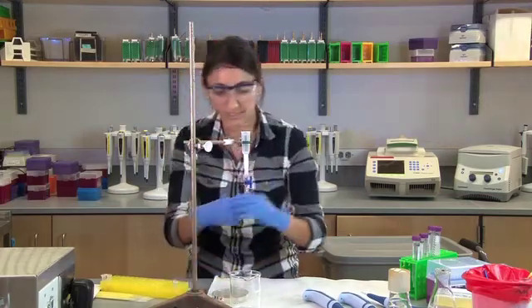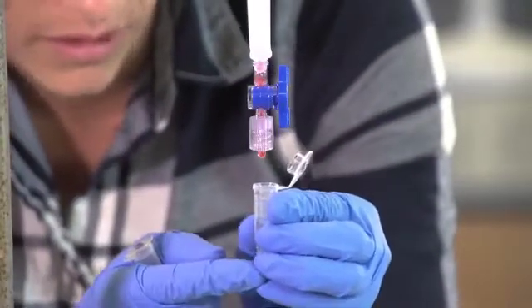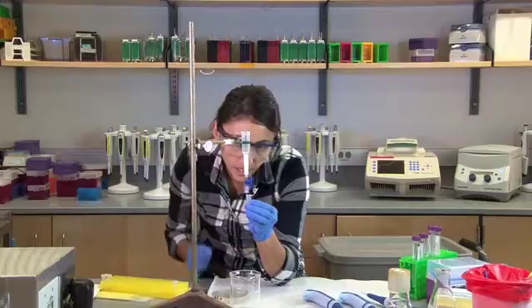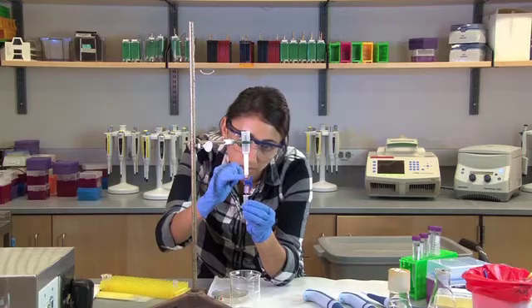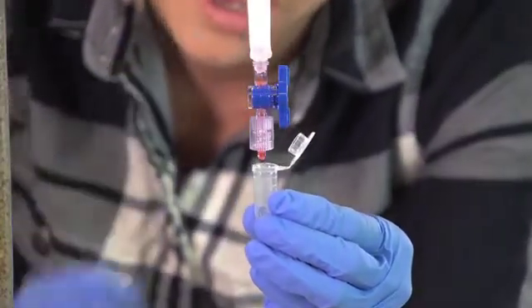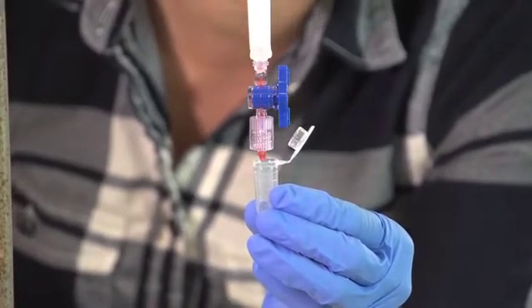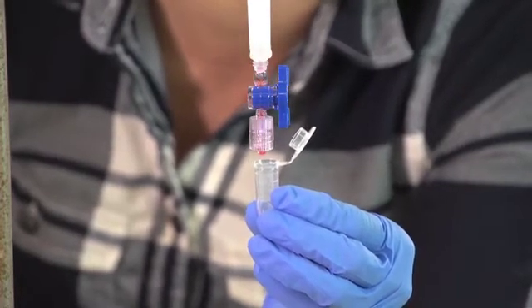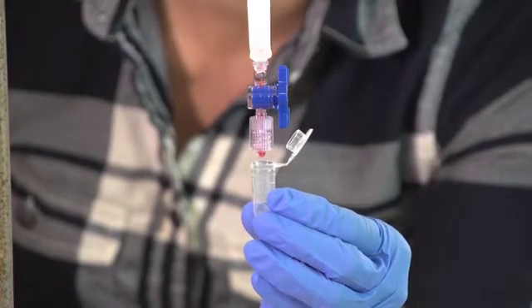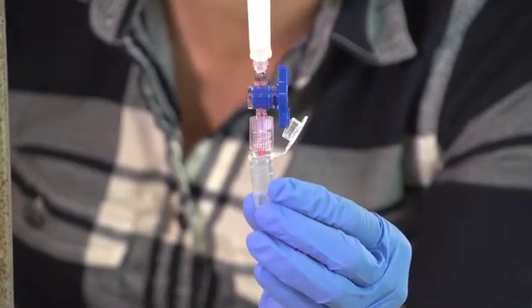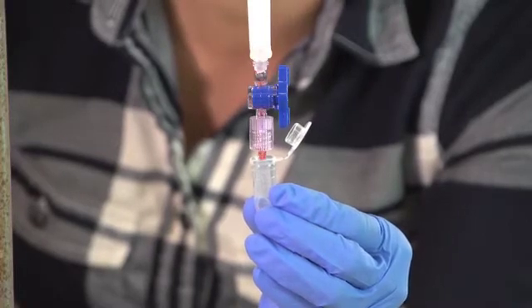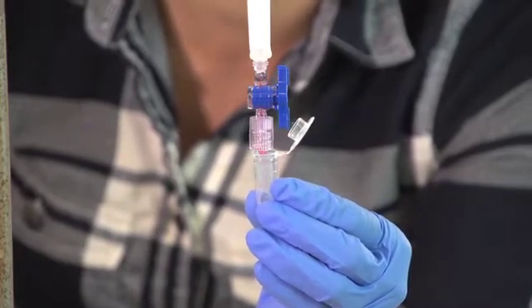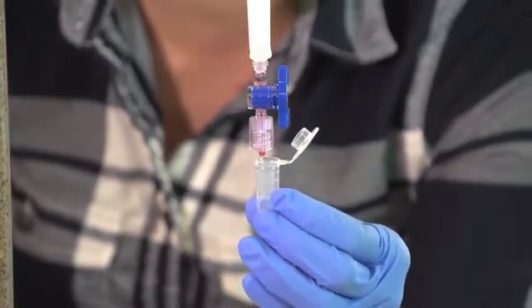Okay. That's tube one. If I were a student, I would go to open my second tube and start collecting. And I can still see that there's pink on my column. There's pink above the stopcock. There's some pink below it as well. So I still have a good amount of purified protein to collect. But it's totally up to you and your student as to how much you collect. If you have one tube, you're fine. And you can put that on a light box and look at the fluorescence with that one tube. If you want to see an array of the fluorescence, you know, your first tube versus your second versus your third, I would suggest collecting three.